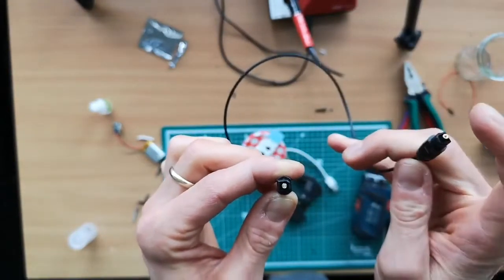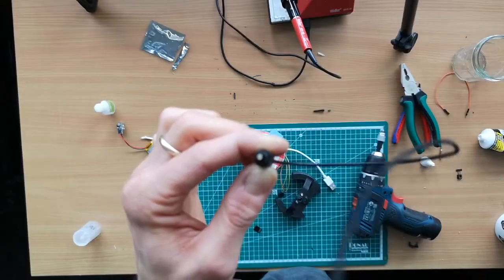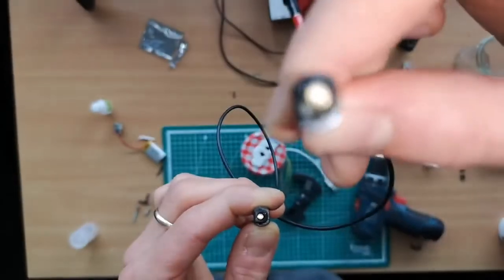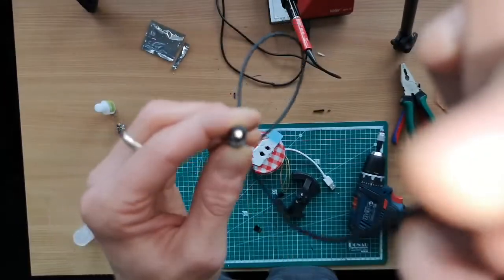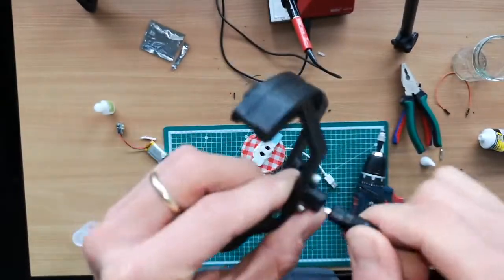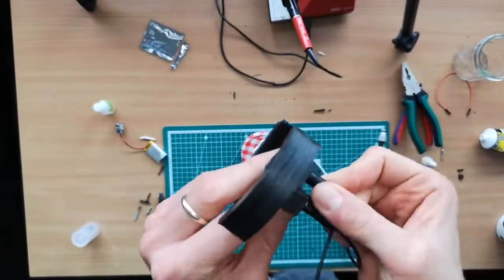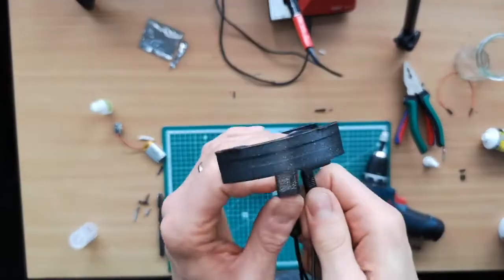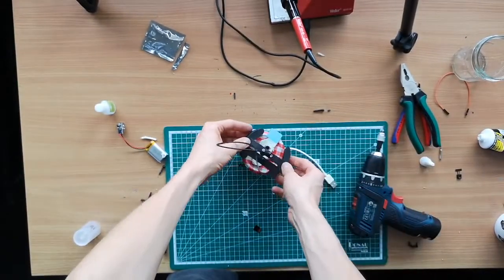So the idea is to have the LED from the device as an illumination. You can also visualize that when I'm turning on the flash and pointing it towards the flash, you see we can make use of it as an illumination source. Right. And so this here just plugs in on one side, make sure it's tightly packed in, and also make a twist so that it's a bit more compact. There's one direction that's a little loose, so make sure that's in the correct direction, and then it looks like that here. And with this we can then put that on top of our lid.